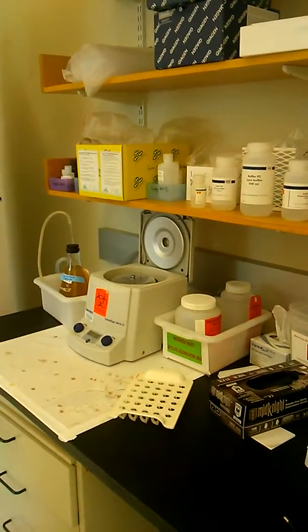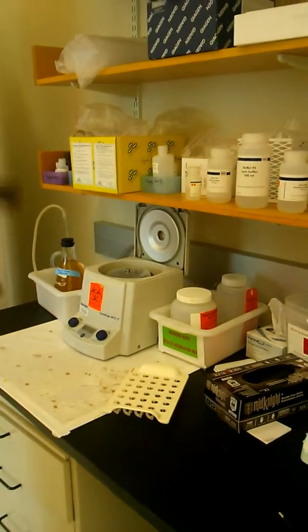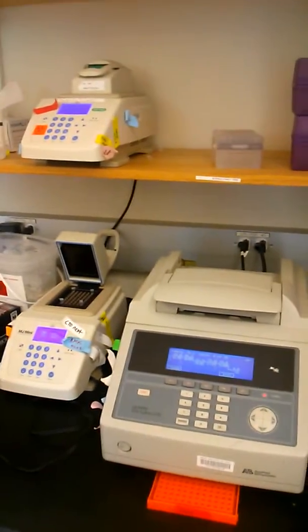Okay, so now I'm going to show you how to set up a PCR reaction in our lab. This area here is a station both for doing mini-preps and also for setting up your PCR reactions.